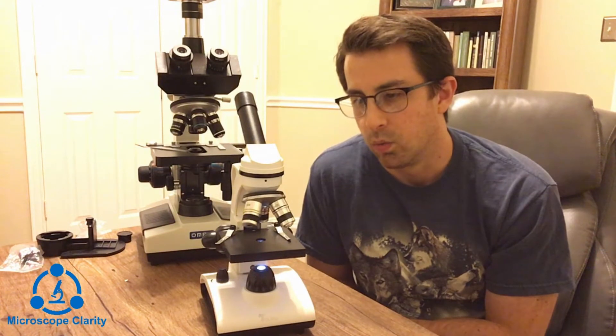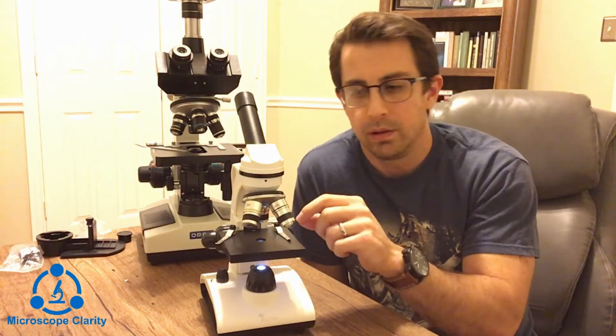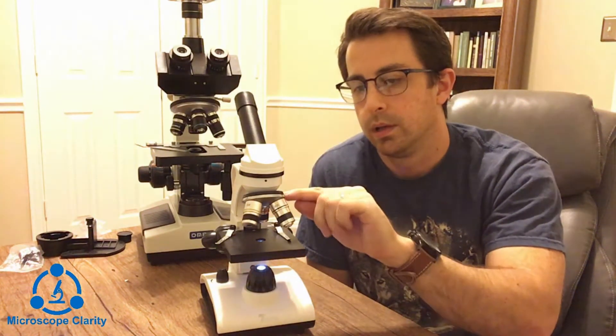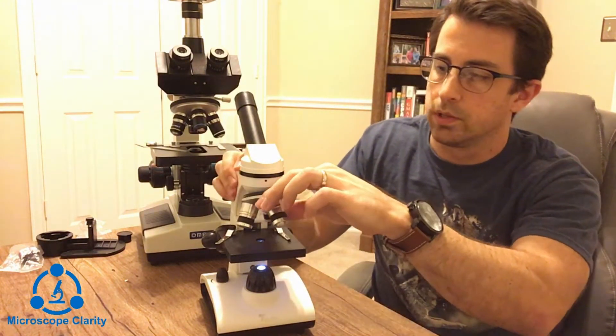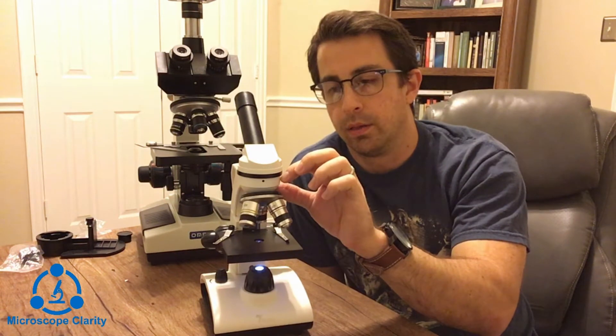Up here we have the objective lenses, which do a lot of the magnification. All of these lenses are magnifying lenses to some degree, but the objective lenses gather light from the light source that refracts from the specimen, magnify it, and start to build the image on the image plane. Holding the objectives in place is the revolving nosepiece, or turret — it swings around and the objectives click into place.